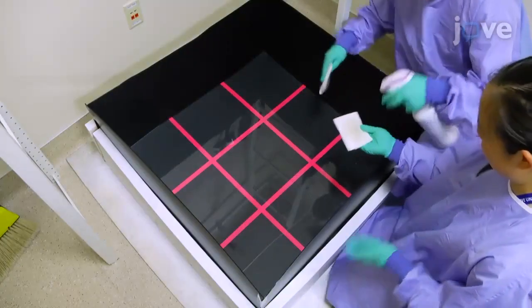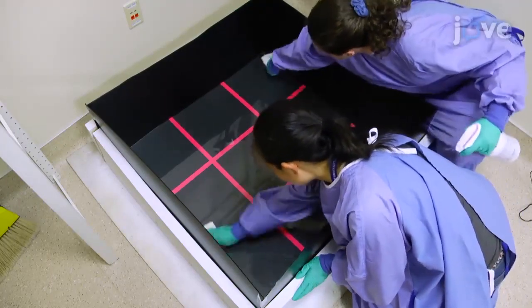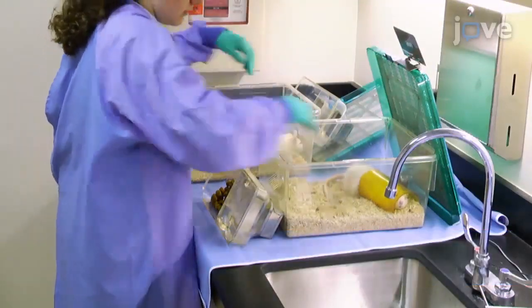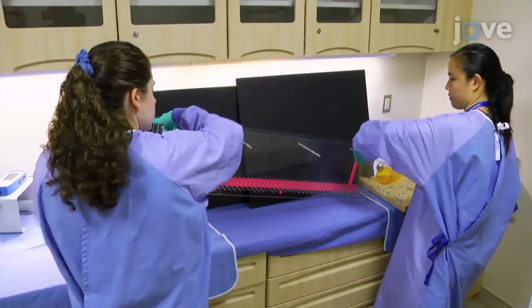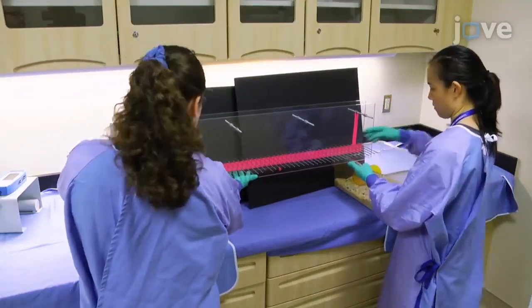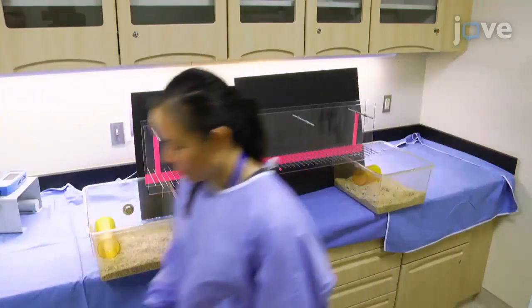Clean the grid with a chlorine dioxide based sterilant, taking care to fully dry the surfaces before testing. Next, for the ladder test, place the animal in a clean temporary cage. Set the ladder apparatus up to span two cages, where the start cage is a clean cage and the end cage is the animal's living cage, an incentive to complete the run.